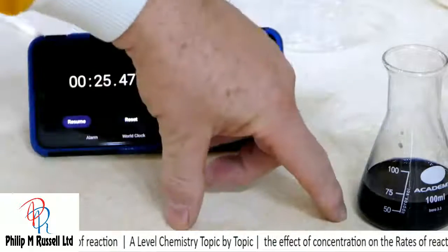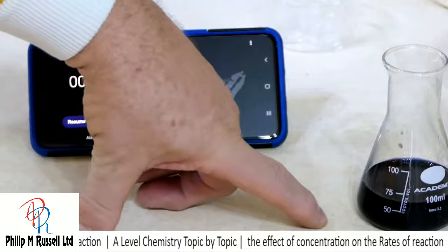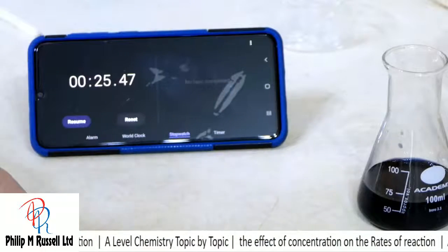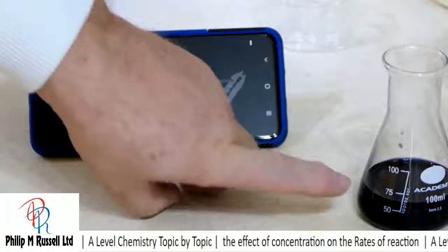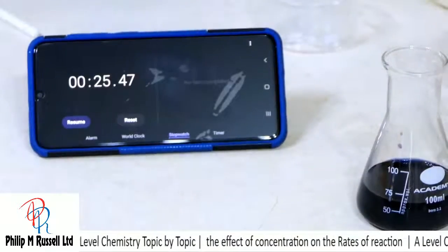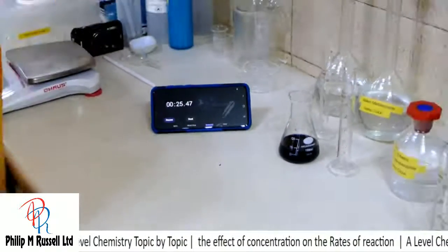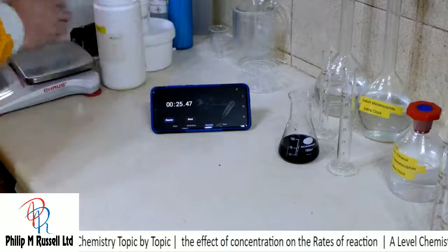And if I change the concentration of this, then what we can do is we can achieve different results, and we can get these changing time quite amazingly. So let's have a go at doing that.